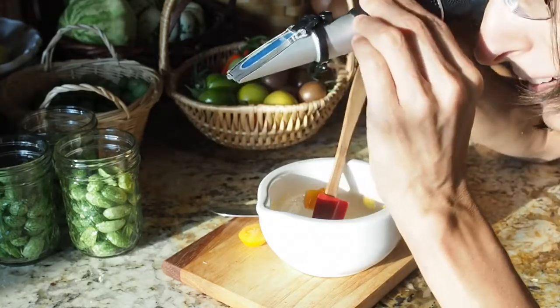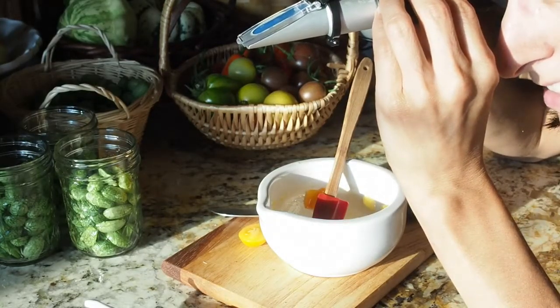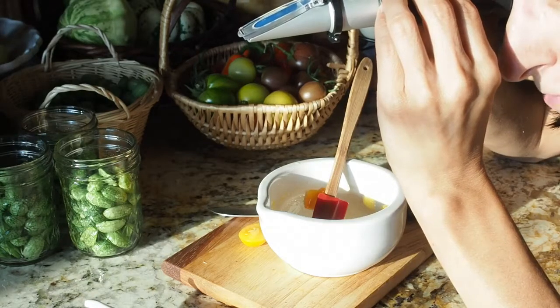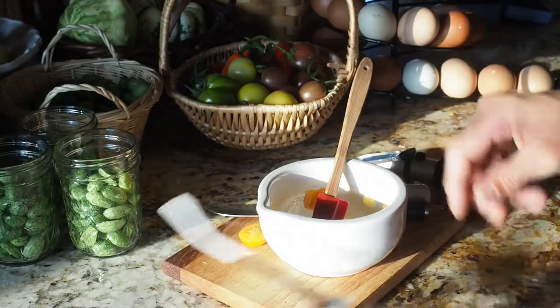Once you look through it, I'll show you what the Brix is. This one looks like it's around six and a half, so about average from what I've discovered on my previous tomatoes. So the black cherry continues to be the winner.